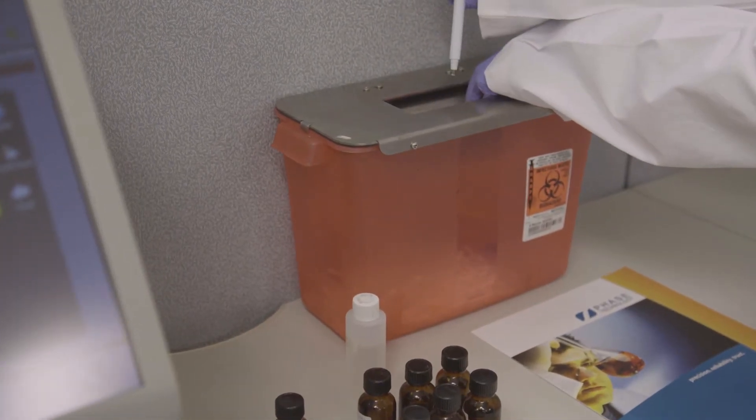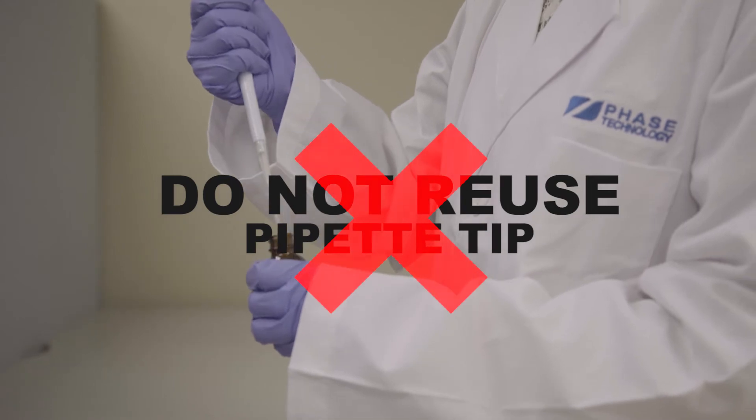Discard the used pipette tip. Do not reuse it since this can cause contamination.